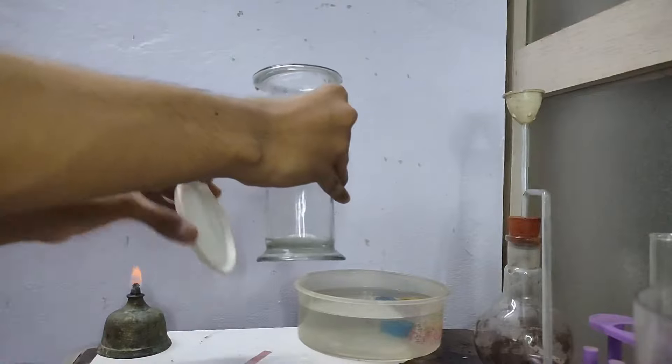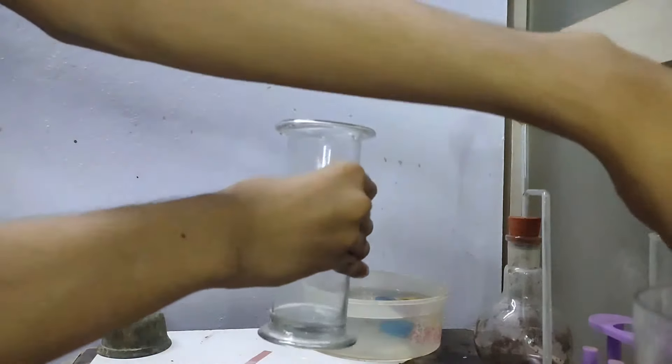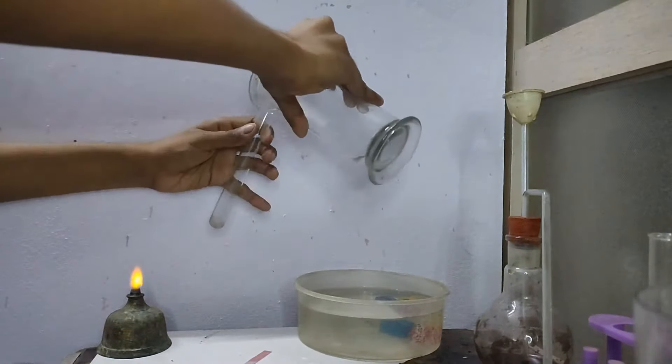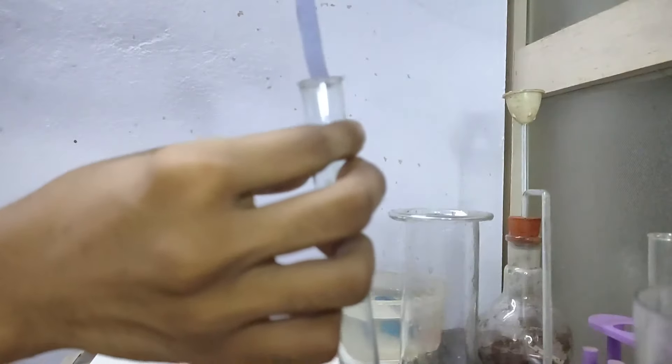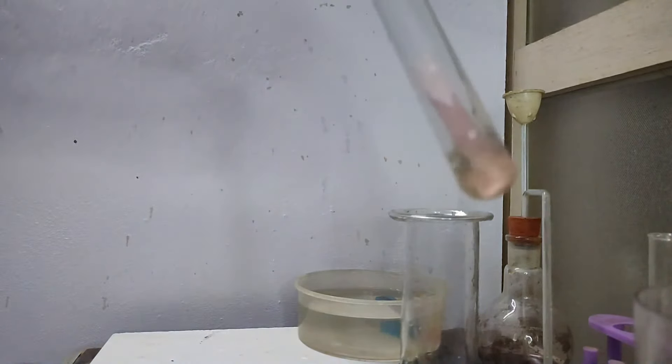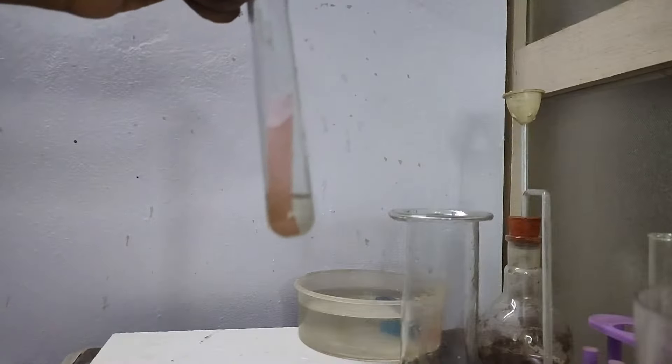Since this gas is fairly soluble in water, I took out the solution and you can see it turned blue litmus paper red which confirms that it is sulphurous acid.